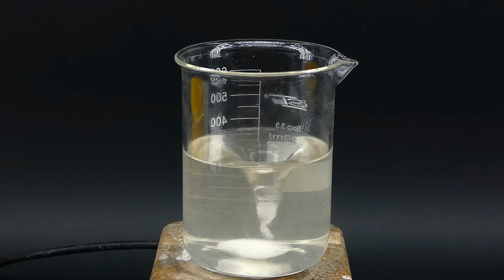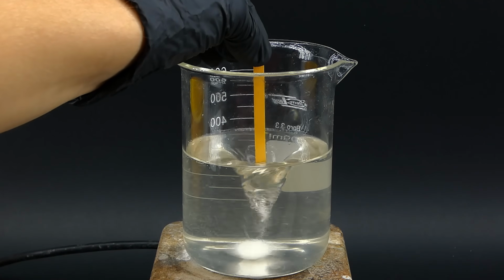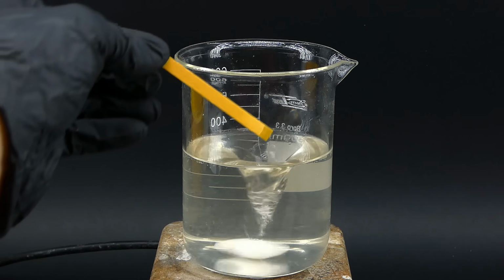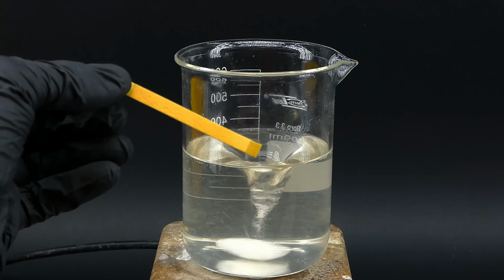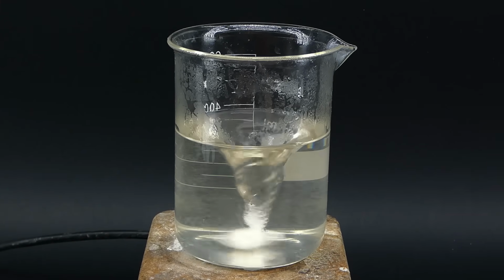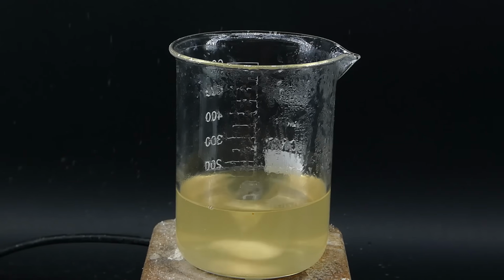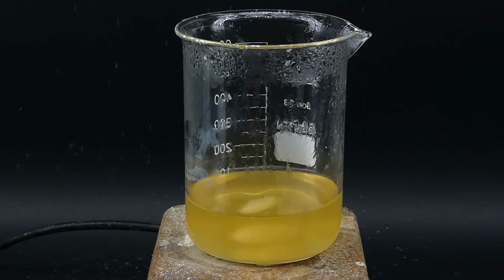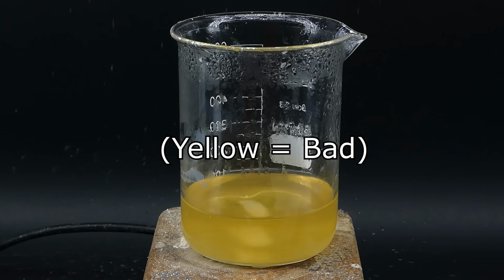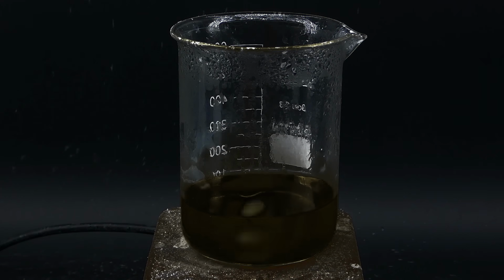It is going to be an extremely long process, but I can't think of any better one, so I just turned on the heating and waited. I also checked the pH to see if there was an excess of any of the reagents, but it came out to be neutral, so the overflow fortunately didn't affect the ratios that much. The water slowly evaporated from the solution, concentrating the sodium acetate further and further, and at some point the solution turned yellow and cloudy for some reason, which was rather bad, but I pretended like the yellow wasn't there and concentrated the solution further.